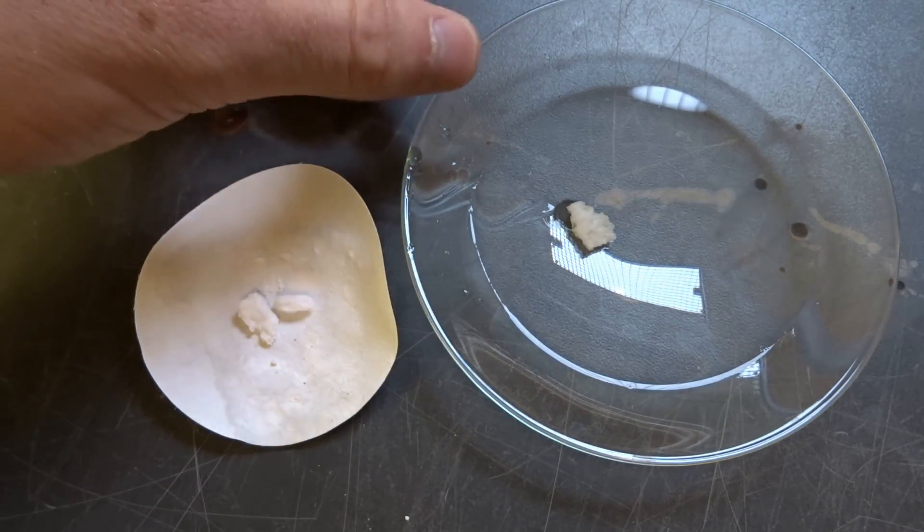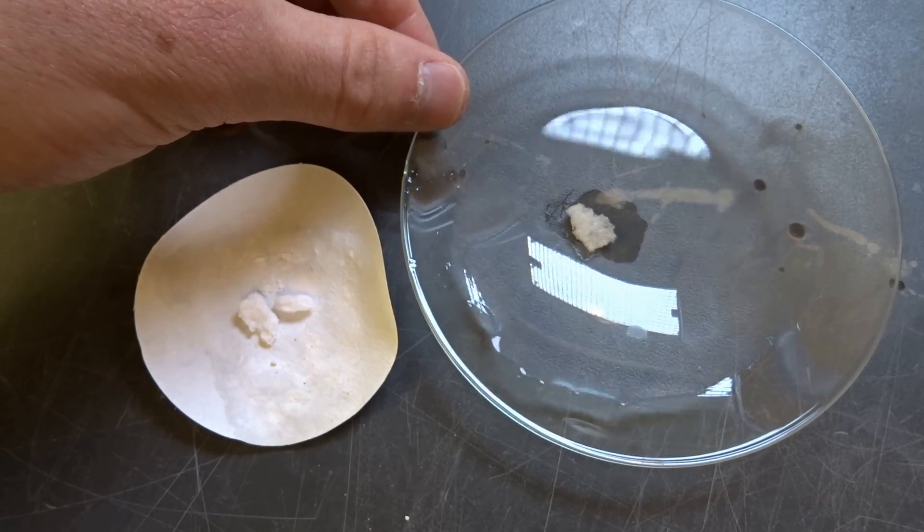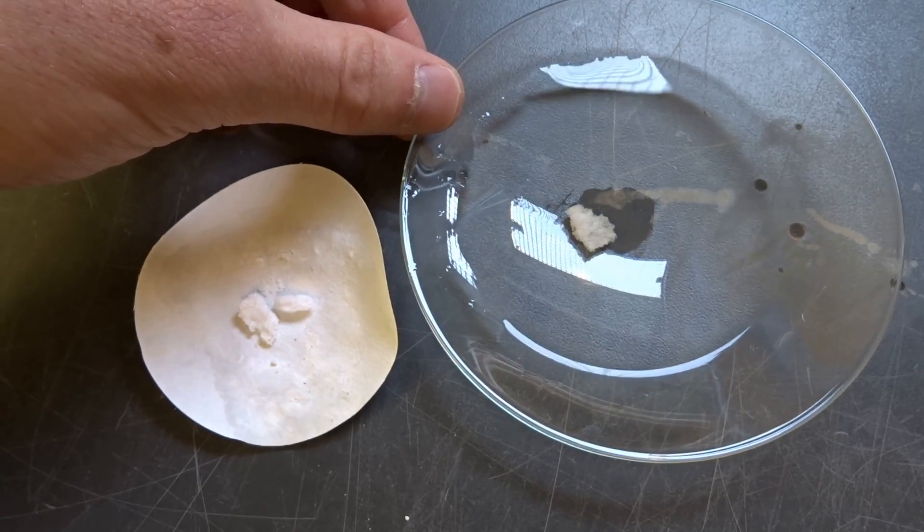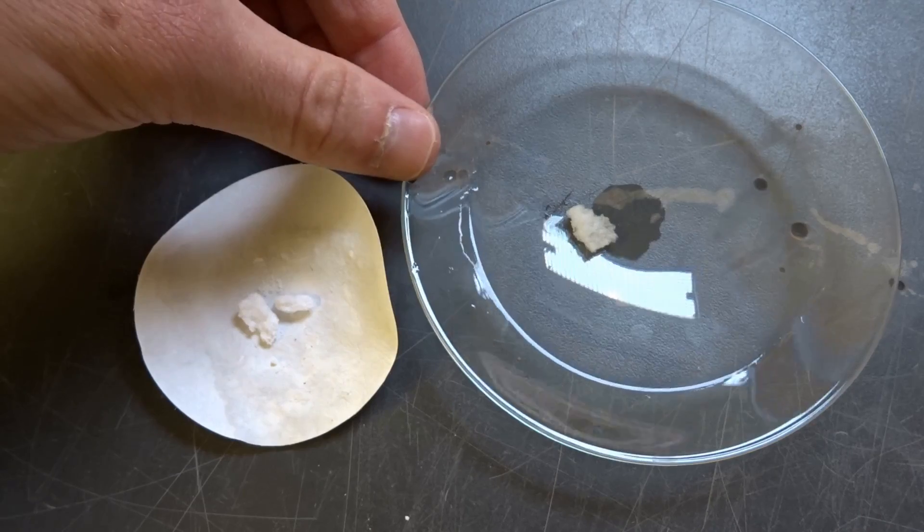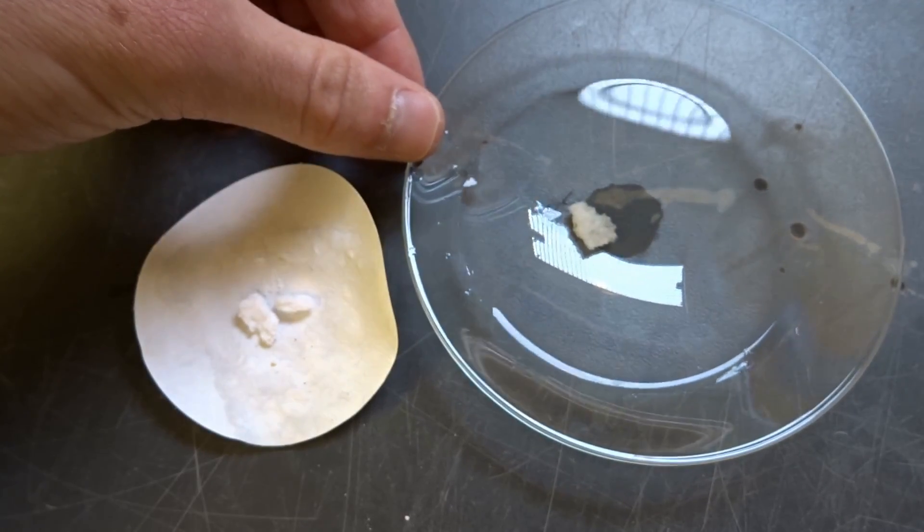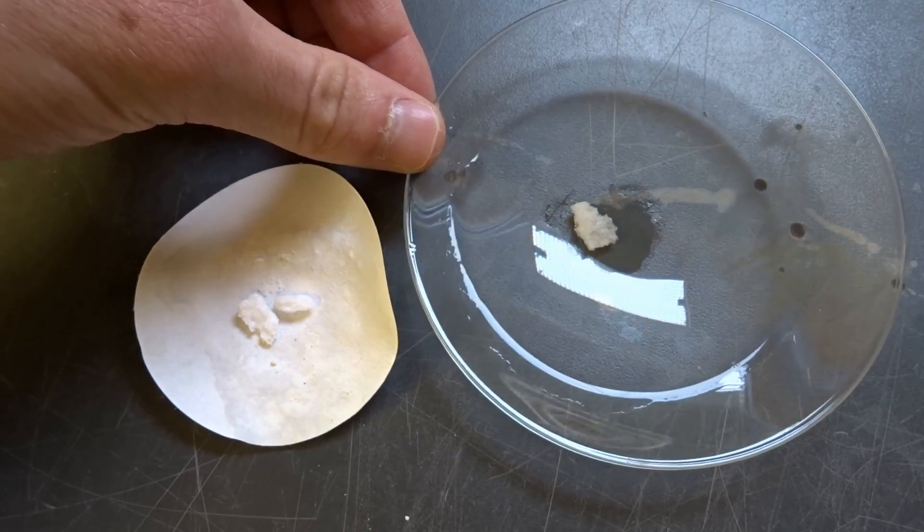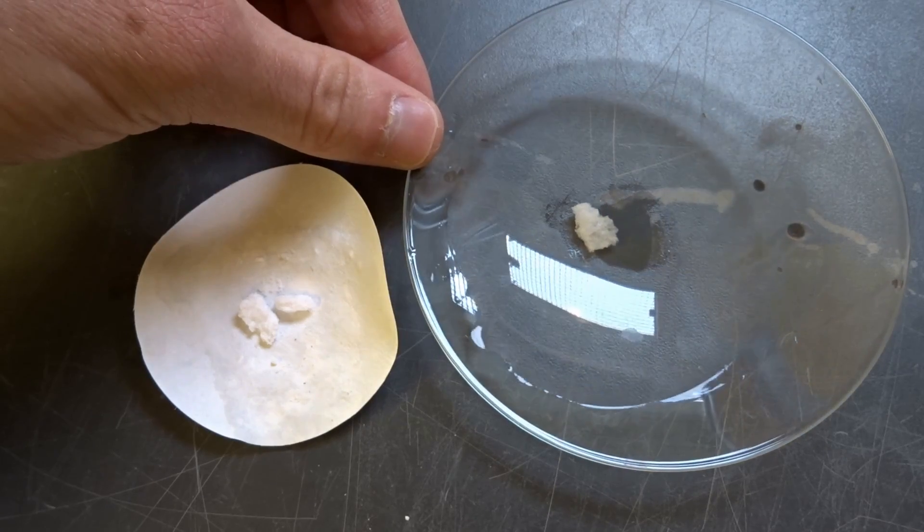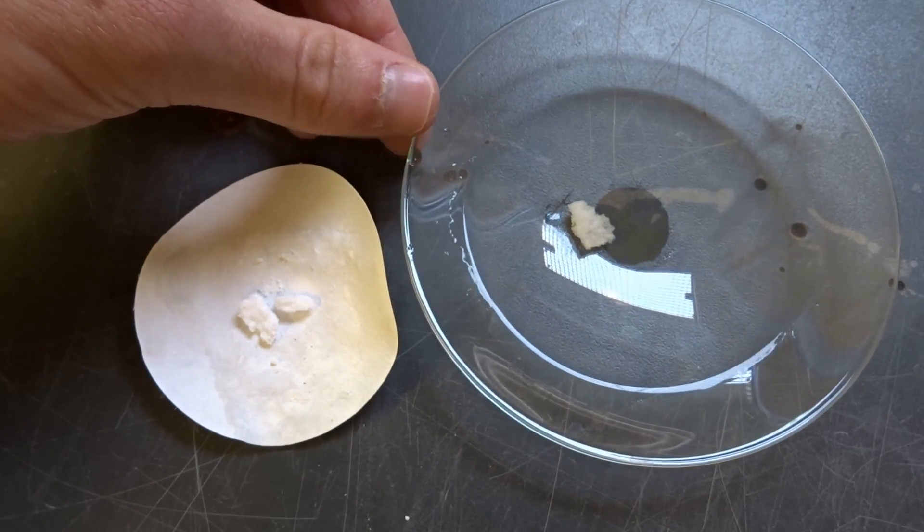So this means that this is not an aerogel at all, because they are very hygroscopic, they really suck water out of everything, and they instantly fill themselves with water, even if you dried them. And this one just did nothing, so this dried that much and shrunk that much that it just collapsed to a piece of quartz, actually.